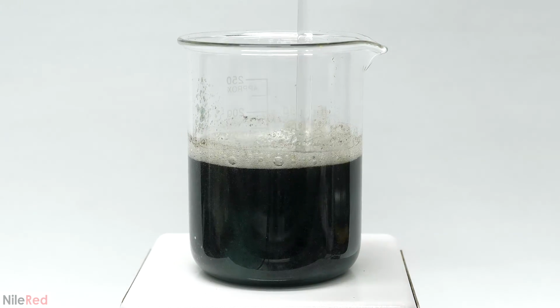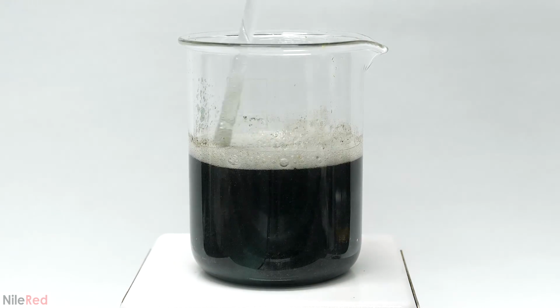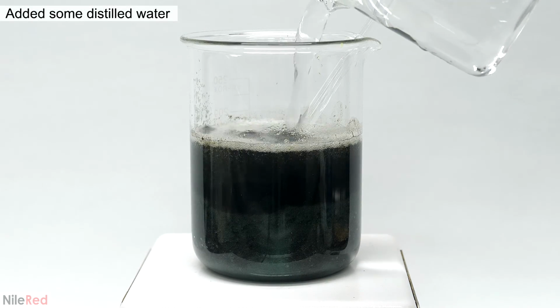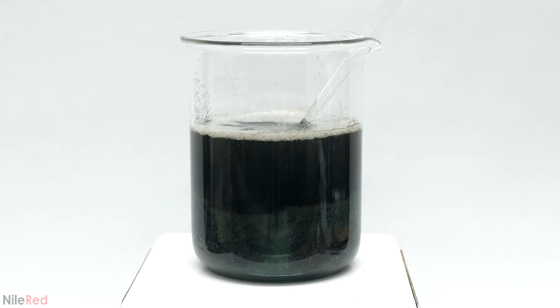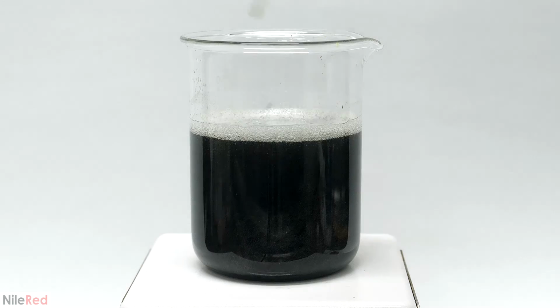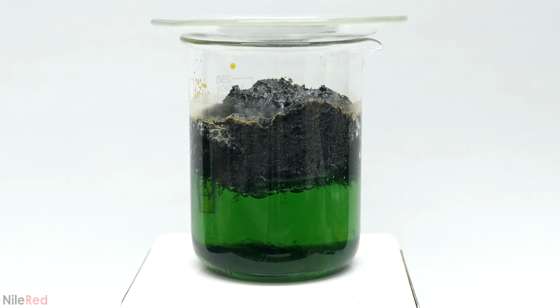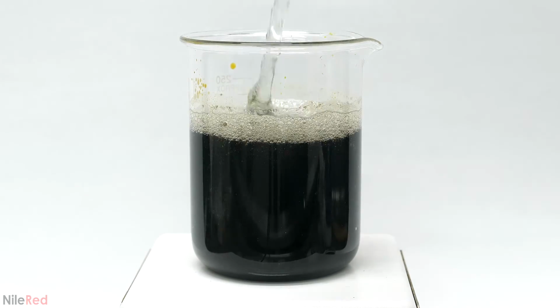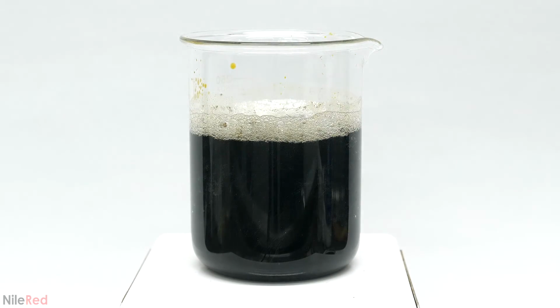I'm guessing there just wasn't enough water to dissolve it all, and it started precipitating out. This was of course quite easy to fix though, and I just added some more distilled water. I mixed it around as thoroughly as I could, and then like before, I just let it sit around for a bit. It eventually separated, and I saw that I had this really nice green solution, and now the next step was to get rid of all this extra junk.